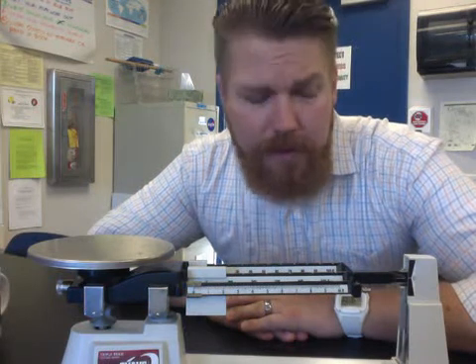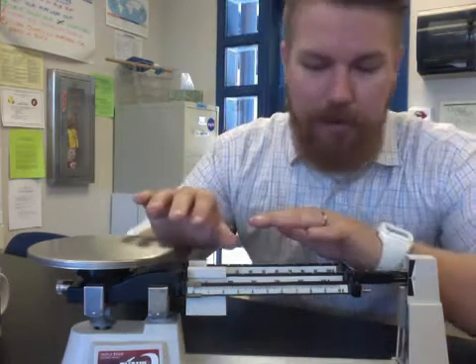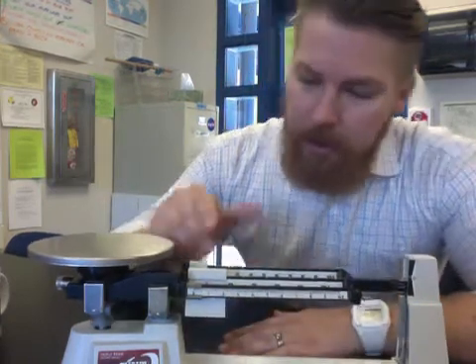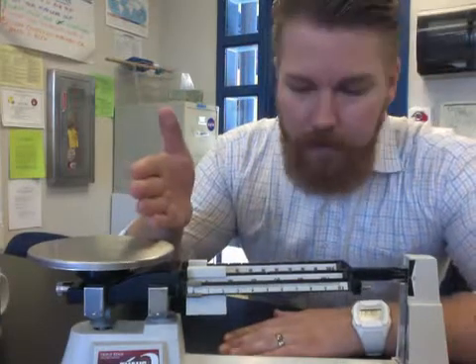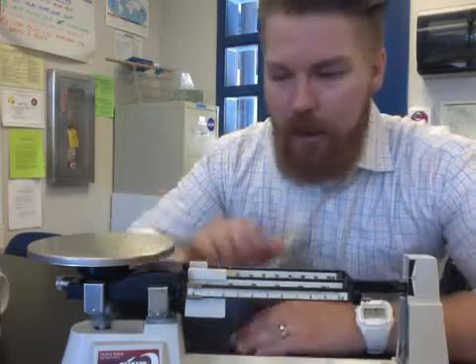Today we talked about how to use a triple beam balance and the steps for that. I'm going to review that really quick and show you what to do. The first thing we want to do is make sure all of our weights are all the way over to the left — they should all say zero. Make sure they're in those little notches.